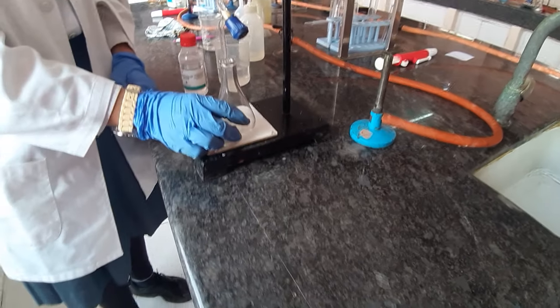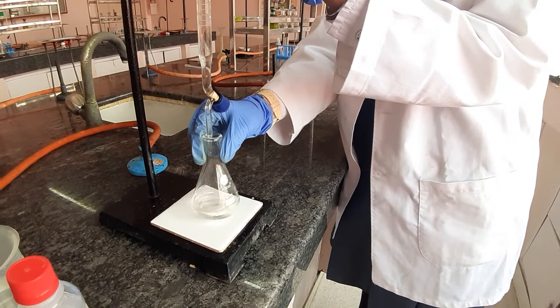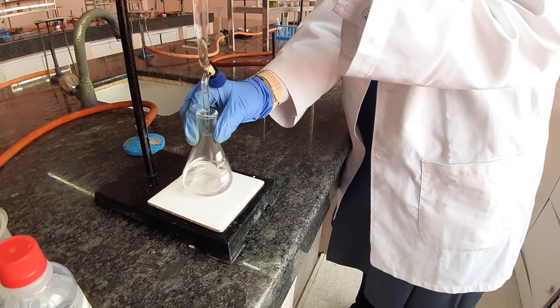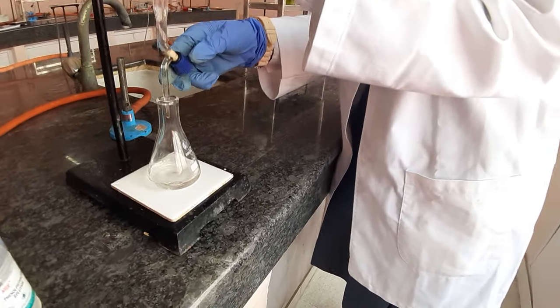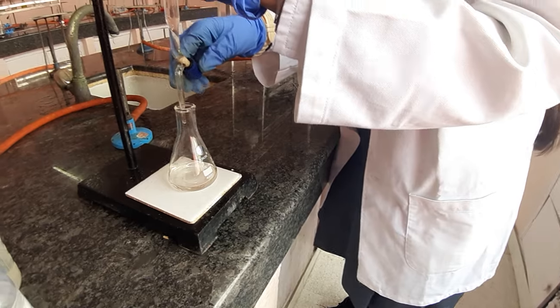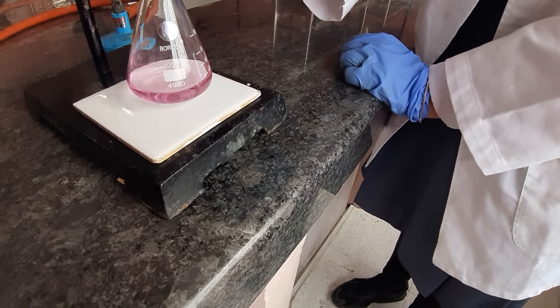Take your titration flask below the burette and start addition of NaOH to it. She is adding NaOH and you can see a pink colour forming at the centre — when she stirs it, this will vanish. The NaOH being added goes to the centre and at that area becomes basic, which is why phenolphthalein is showing the colour. Continue adding cautiously till you get the lightest possible pink with continuous stirring. Do not add large excess to give a bright pink. She is trying to get the lightest possible pink — check for it on the white tile only, otherwise you won't know the lightest possible pink. That's the lightest possible pink she has got, and this is where you will stop.